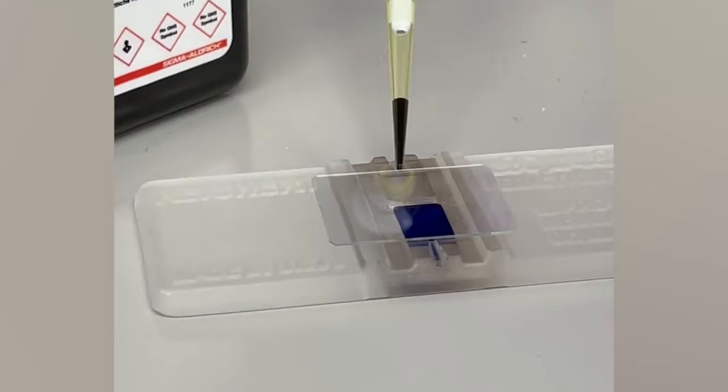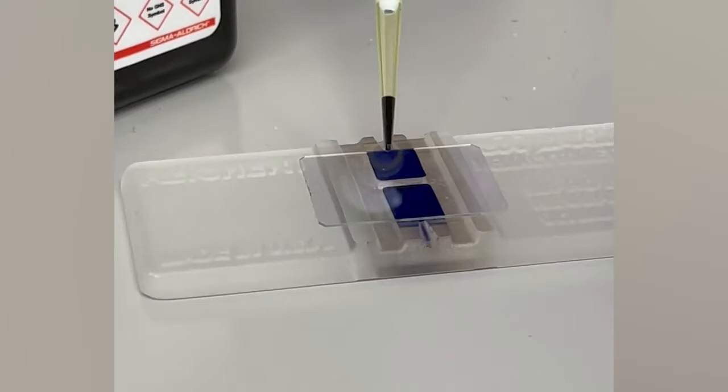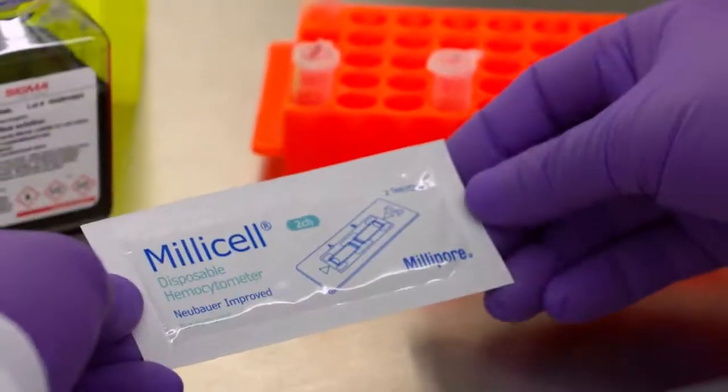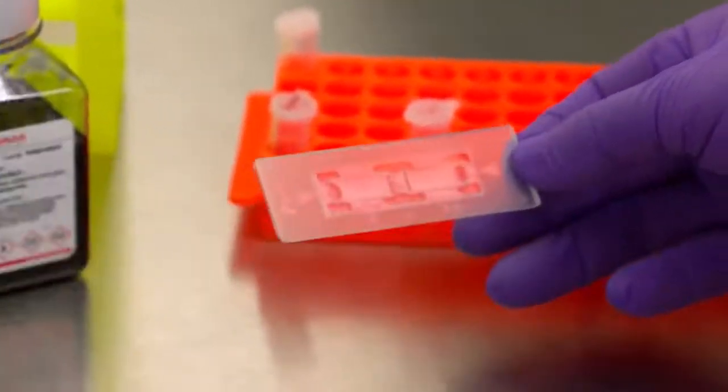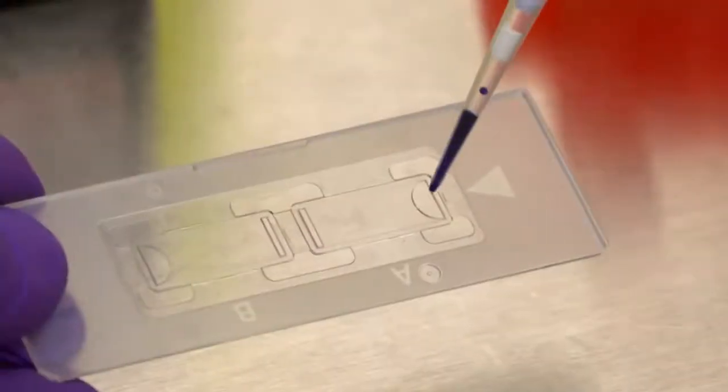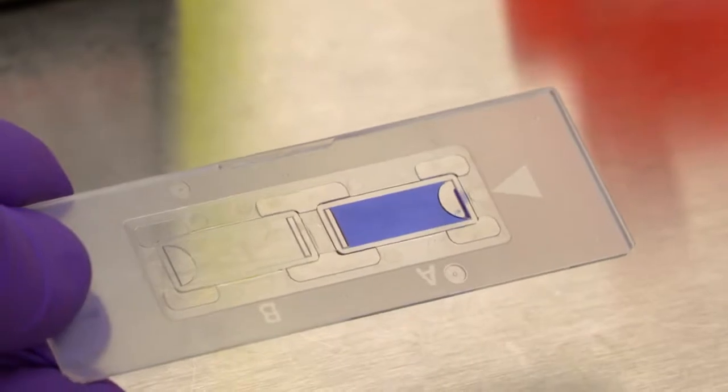Please make sure that both glass cell counter and glass cover slip are cleaned before and after use. Alternatively, one can substitute the traditional glass hemocytometer with high-precision disposable hemocytometer which does not require tedious cleaning steps. These are one-use devices and do not require cover slip to operate.